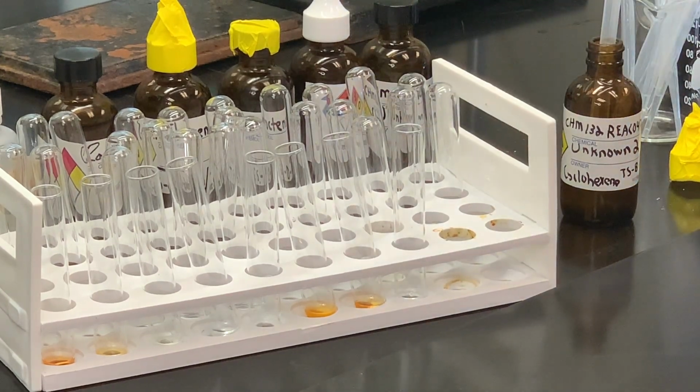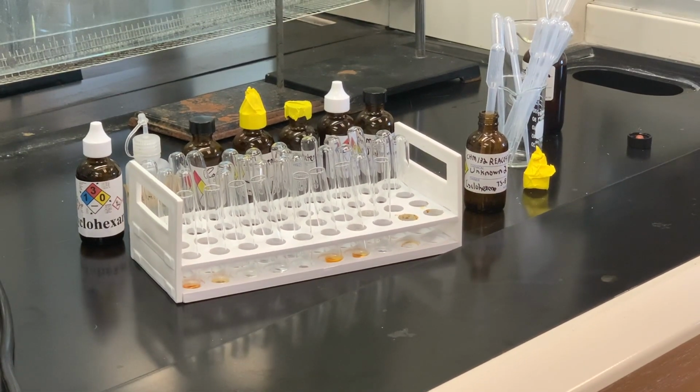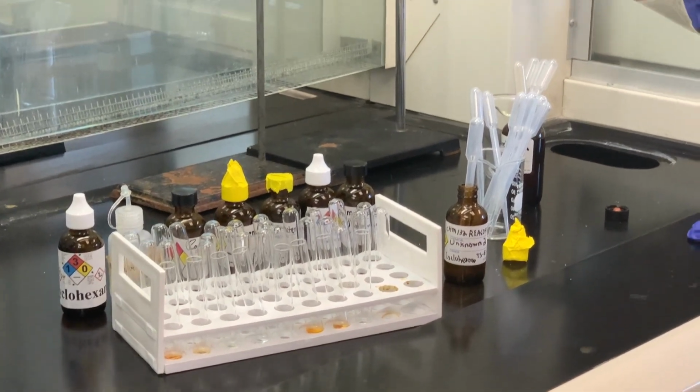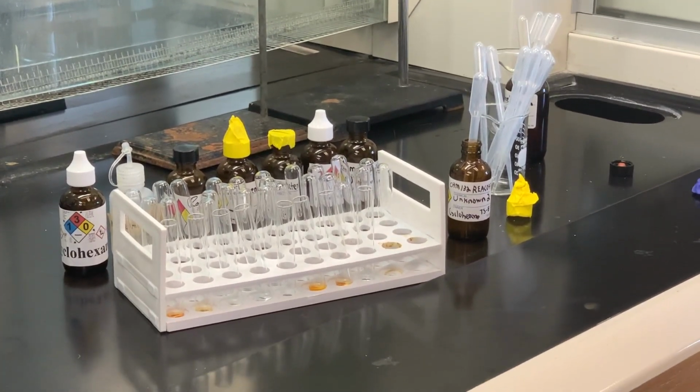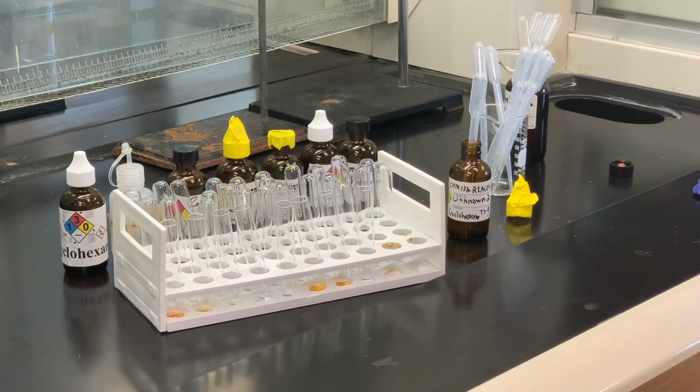I do want to say one thing in terms of what the lab book may ask or state, that if something was negative, they say to keep adding drops, or if it's positive, to keep adding drops. I don't really see the need of that, so if something's going to react, it does so fairly quickly, as you can see here with these. So I may not have followed the exact procedure that's in your lab manual, and I don't think it's necessary to count all those extra drops and go to 10 or 12 drops. I think you can certainly see if there was a result that was positive or negative here.